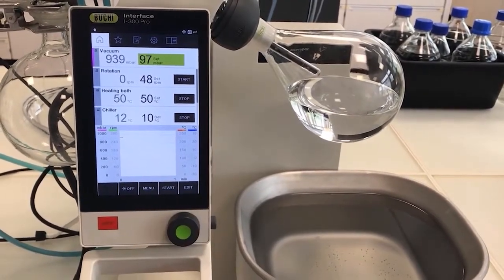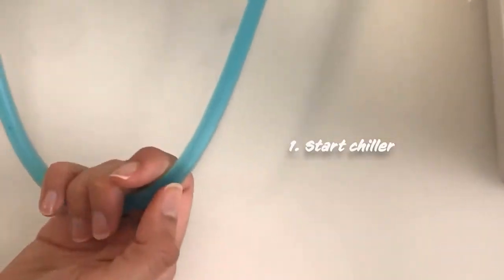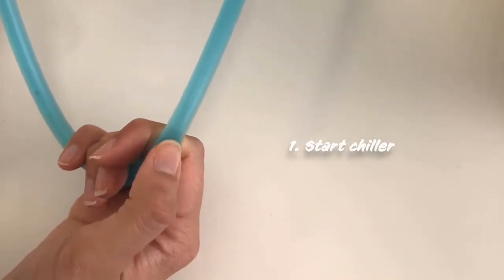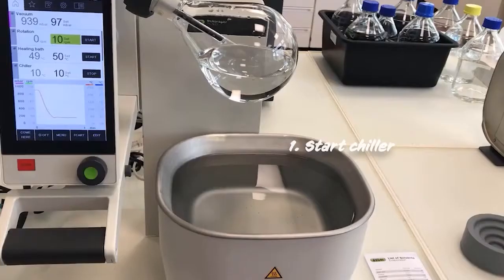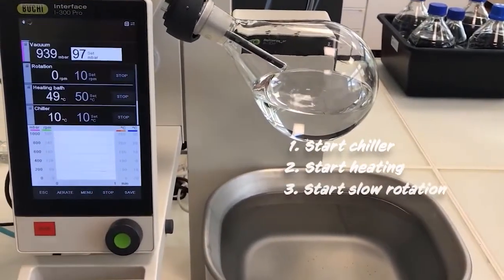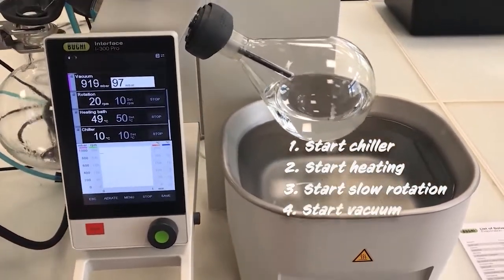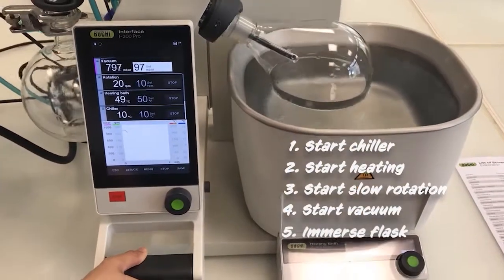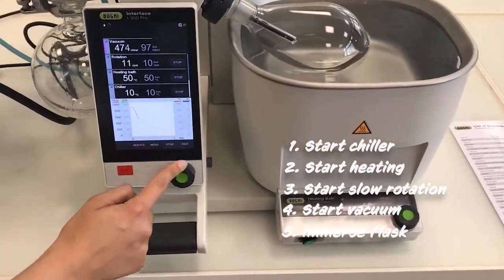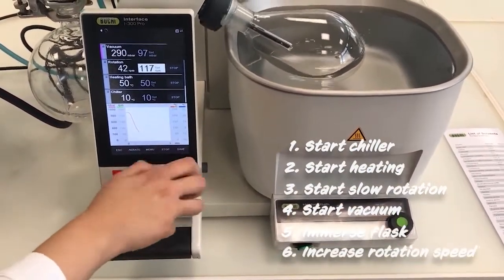Now it's time to start the distillation. Firstly, we start the chiller and check if the coolant is flowing by shortly squeezing the cooling tube. If you can feel a short pulse, it means that the coolant is running. Secondly, we start the heating and then we start the rotation slowly. Then we press start for the vacuum pump and we can submerge the flask deeply into the heating medium. Once this is done, we can increase the rotation speed to 280 RPM. This is the optimal rotation speed.